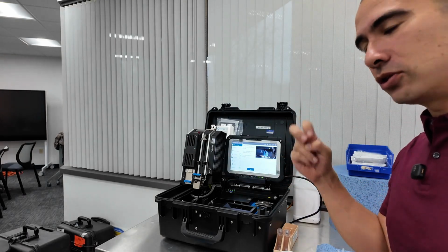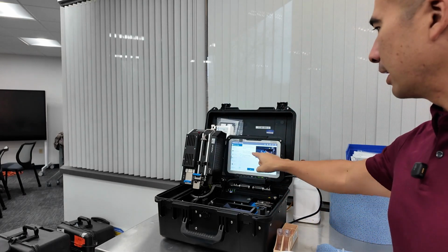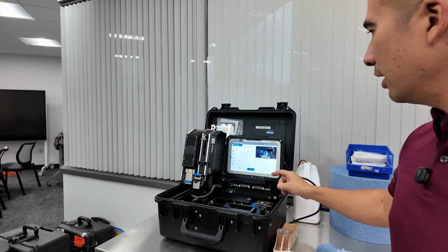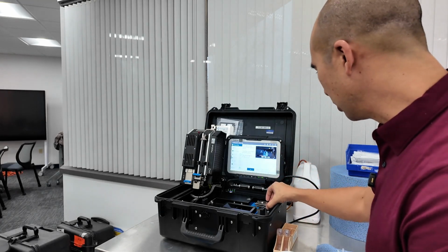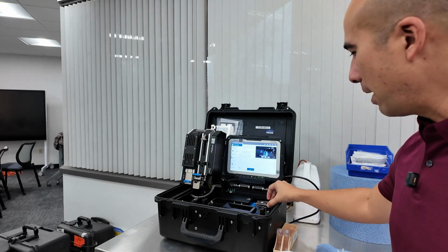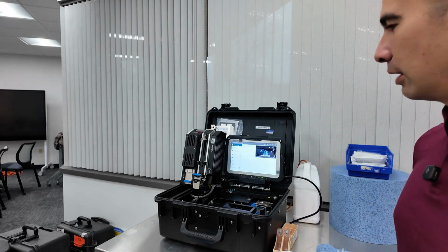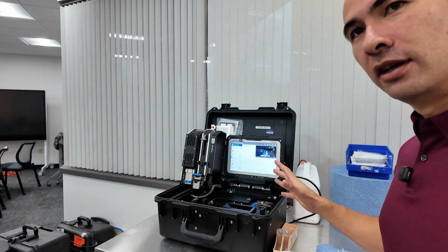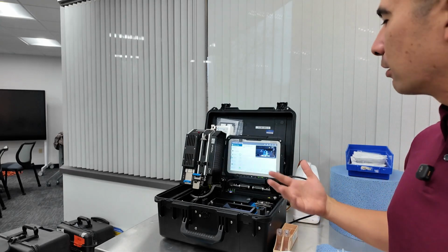So when they say chemistry, this is actually the infrared side of the analysis. All right, first thing, a new background is required. Please make sure that the cell is out. So that's this thing here, right? And we're going to press start just to do a background check. So we can run some of these tests simultaneously. You can see the viscosity is still testing while the chemistry background check is done.